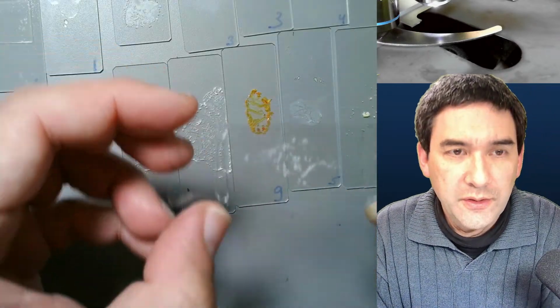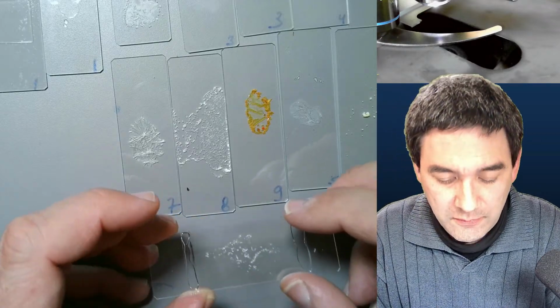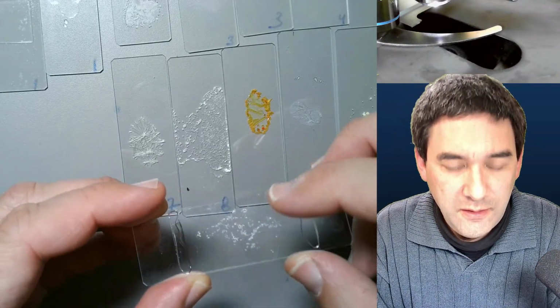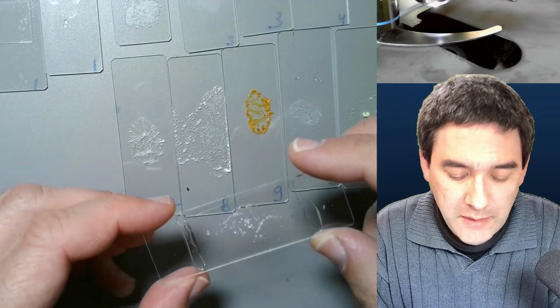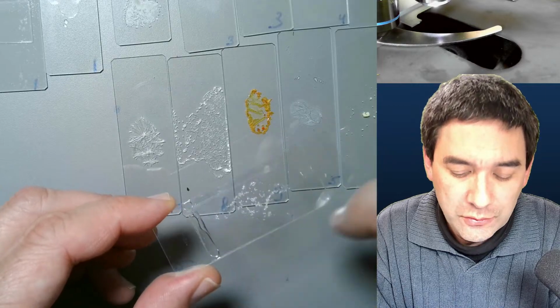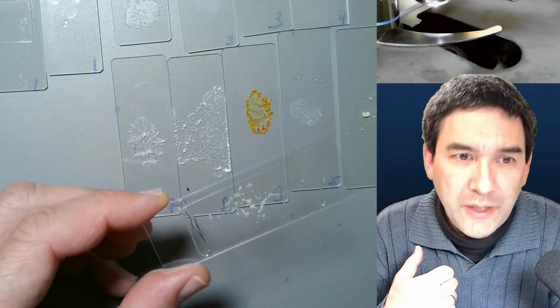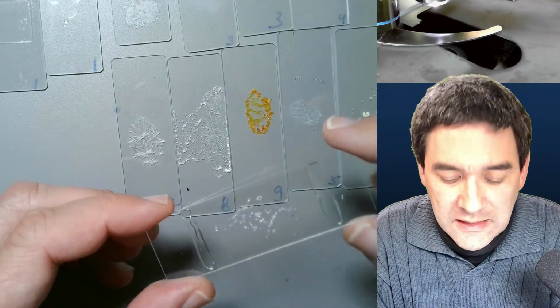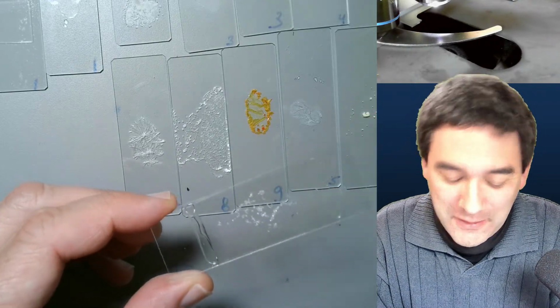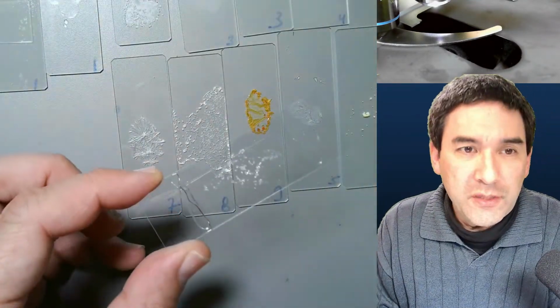Yeah, and it's already solid. Okay. Yeah, it sticks. Okay. So this is actually a possibility. Maybe if the cover glass were a little bit smaller, one could apply also something on the edge here, to completely seal it off, but now at least this is better protected. I'm not saying that this slide is going to last an eternity, but at least that's one thing that I'm experimenting around with. But because I'm already holding it in my hands, let's have a look under the microscope at how it looks.